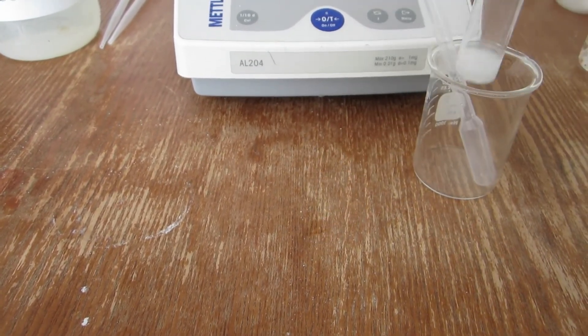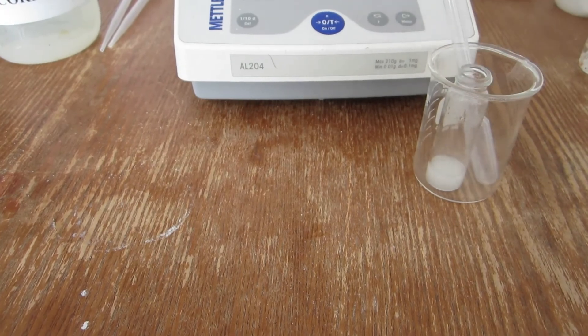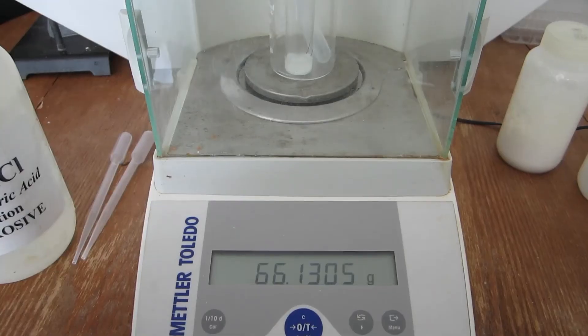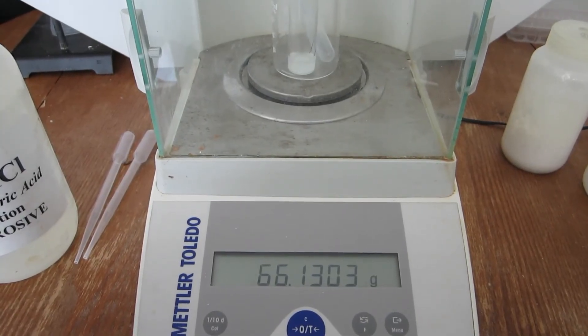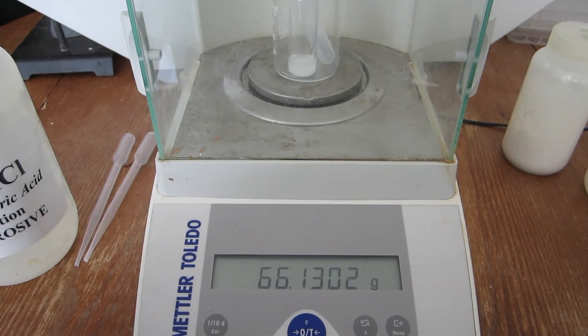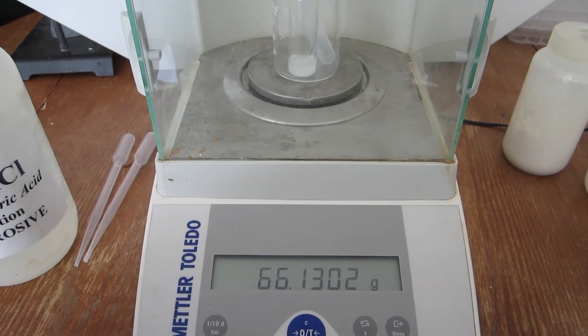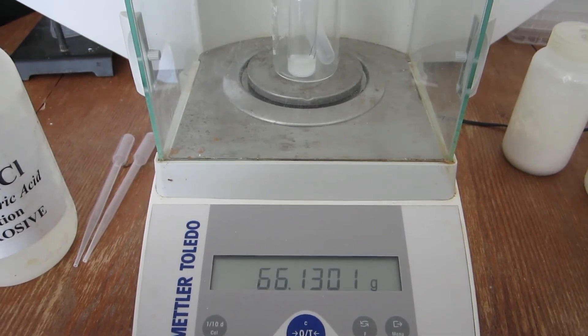After which, the mass is obtained. For the second trial, the mass after the reaction is displayed.